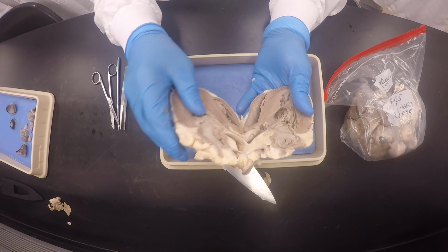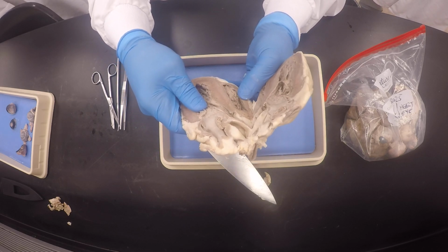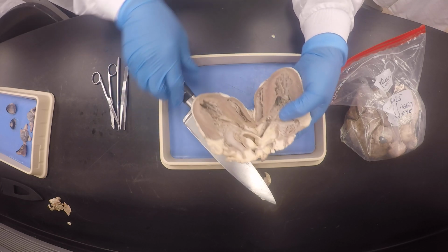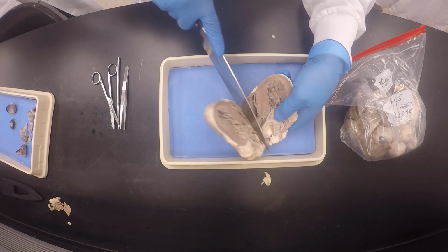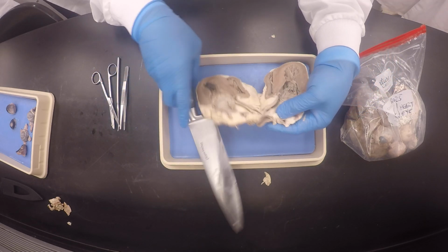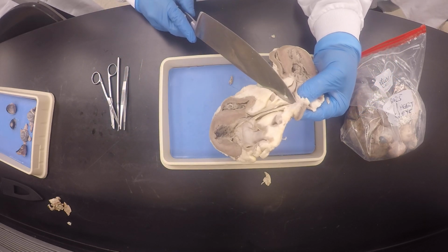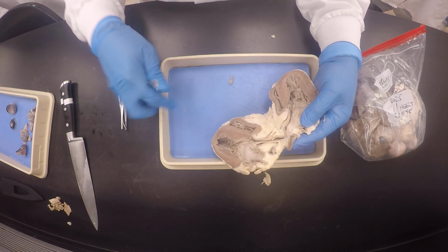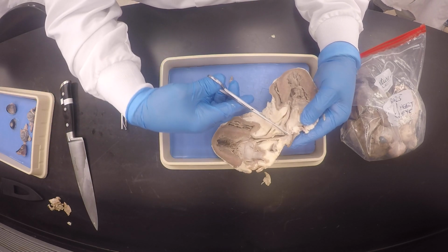Through my moderator band. You see, this time I didn't get so lucky because this point was kind of scooted inwards like that. But anyway, I was still sort of central from my aorta. Do you see what I'm saying? But I cut through my moderator band.